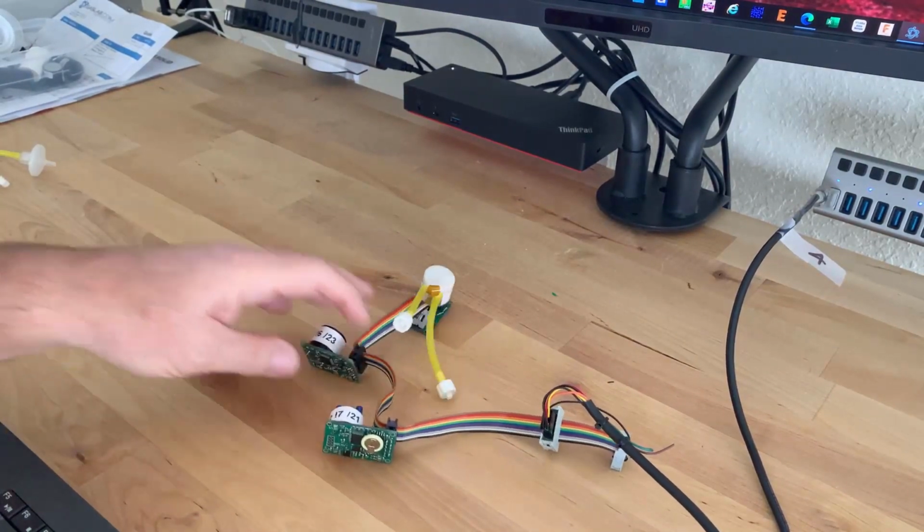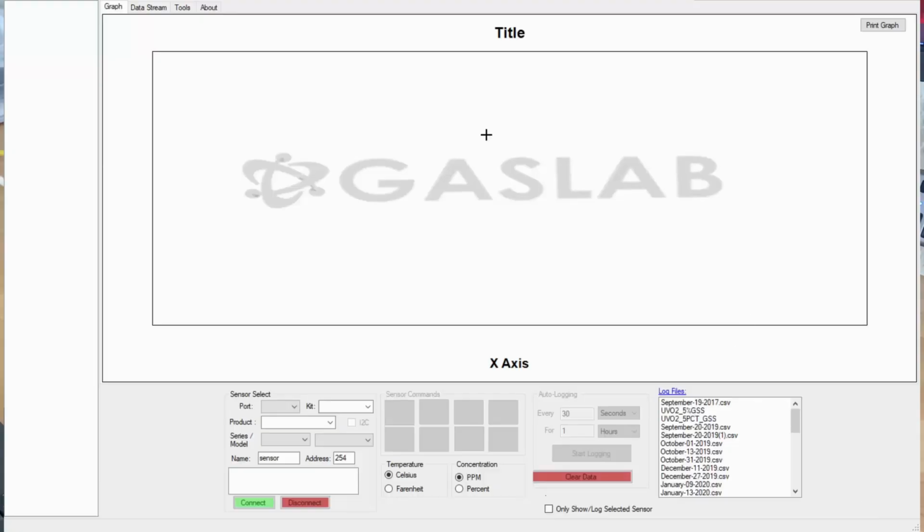Now we want to talk to them, and to talk to them, we're using the GasLab software here. We're using COM4, which we have a USB to RS485 cable connected to, and we are doing MX type system, EC MX series sensors. We're going to tell it that it's RS485, and we're going to give it an address. And who are we going to do first? Let's do the one with the tube cap, and that is address 8. So we connect it up.